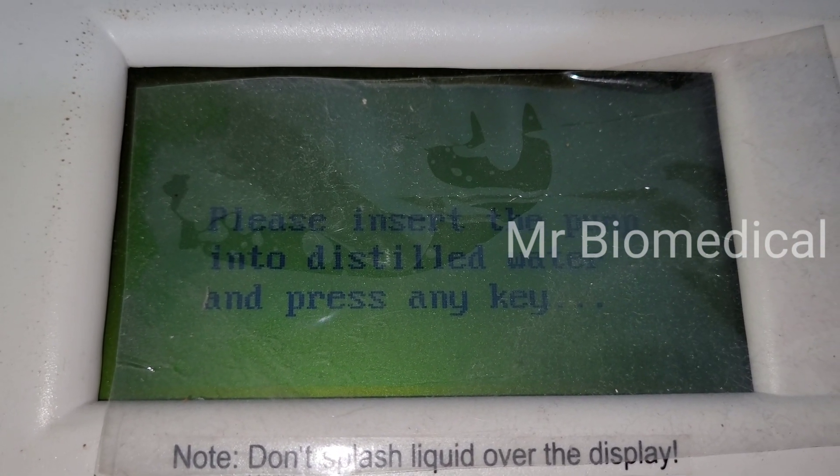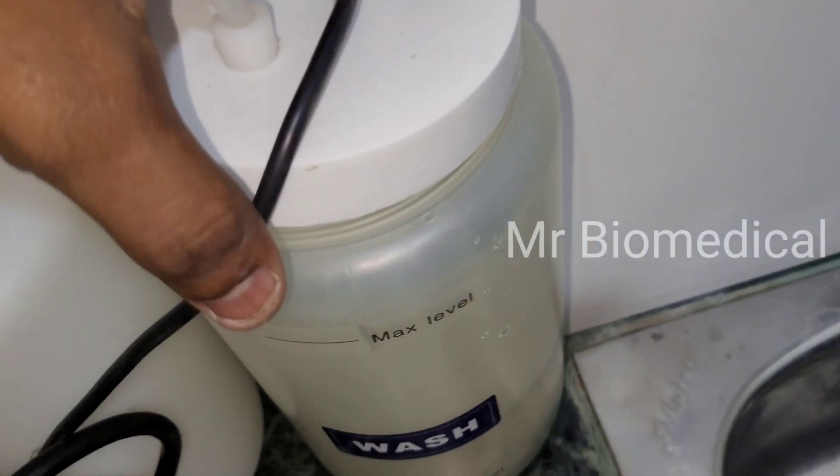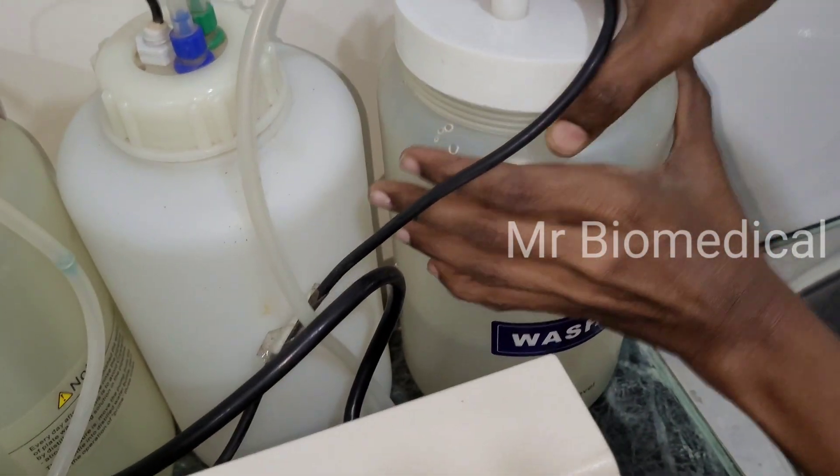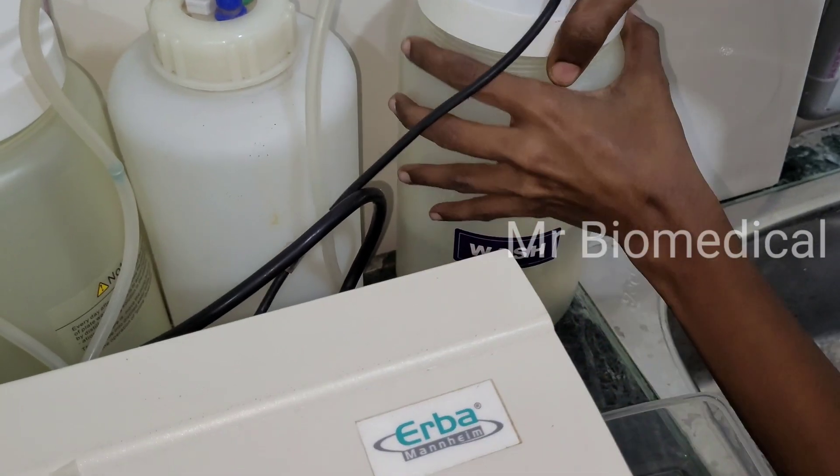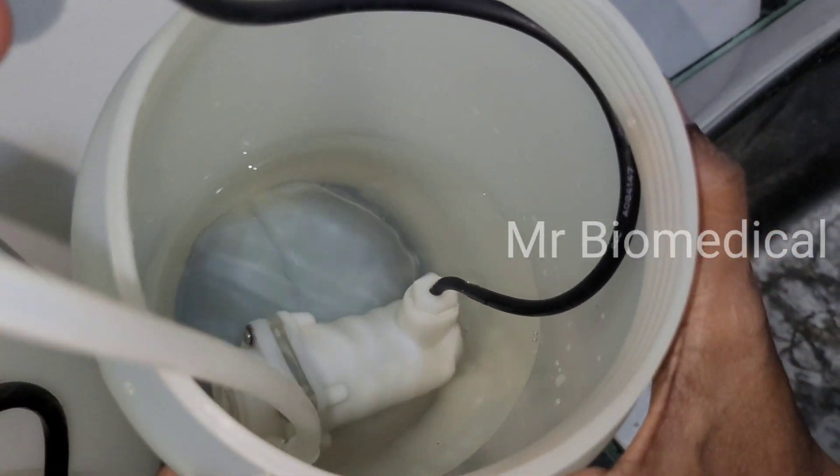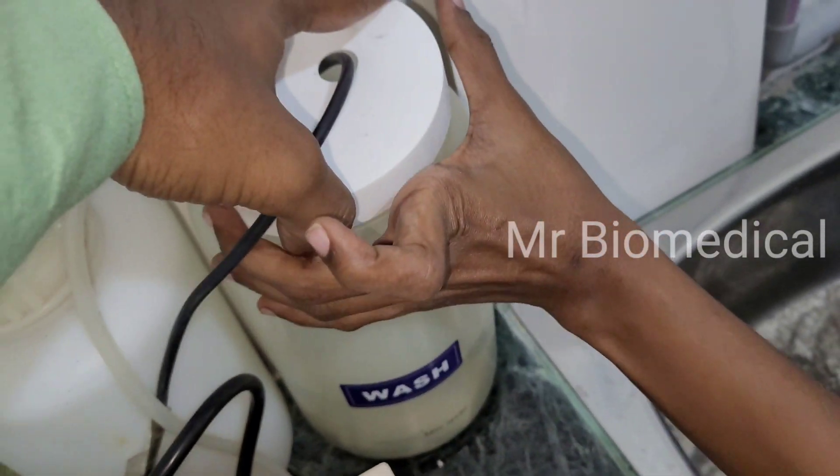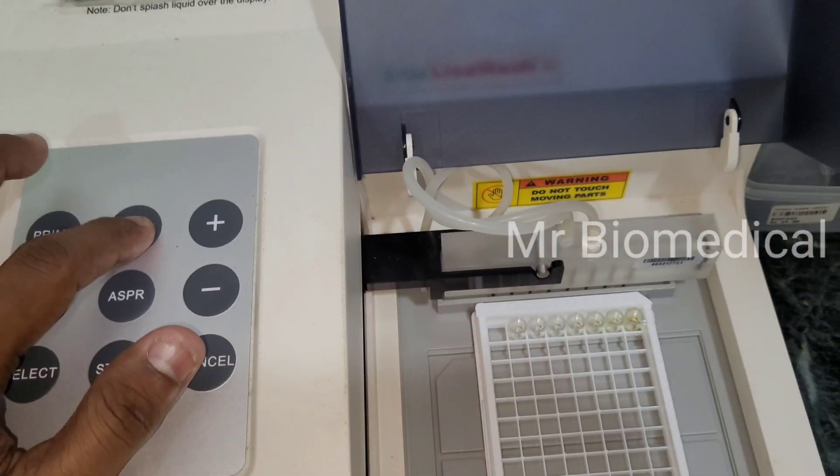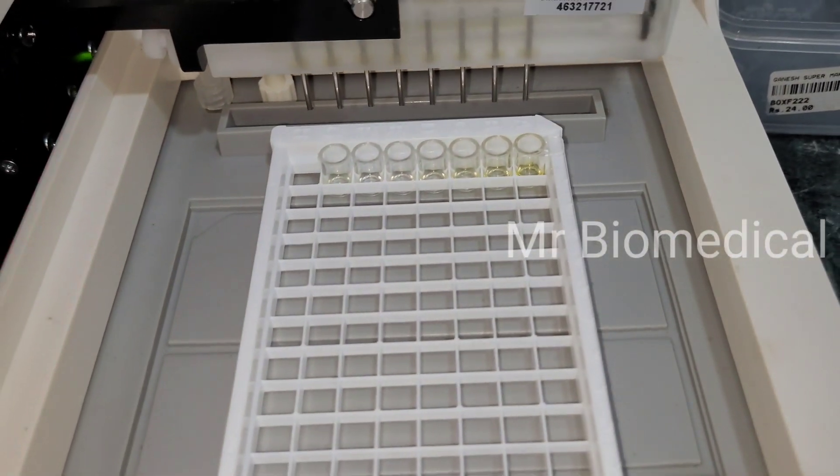So this is a pump, as you can see this is a 12 volt water pump. When I press the rinse button there's no water.